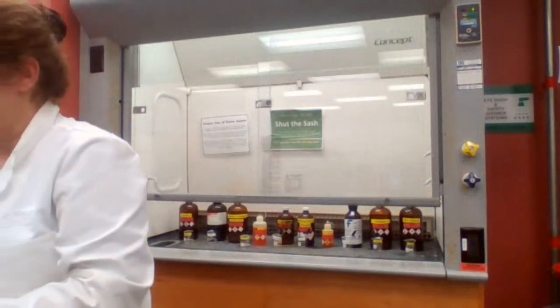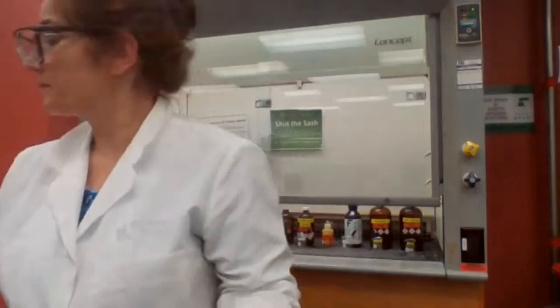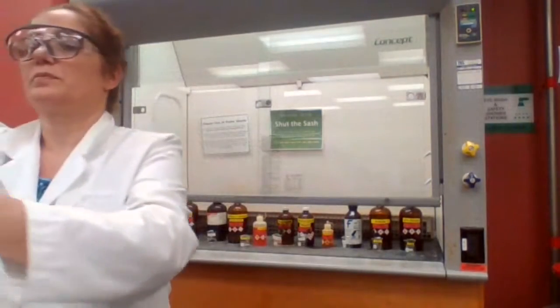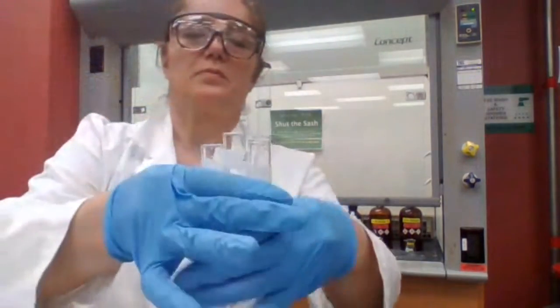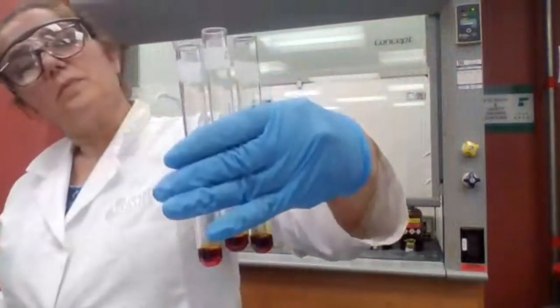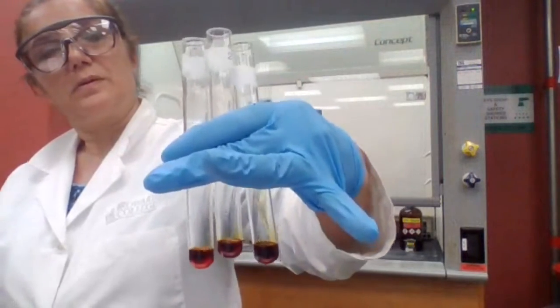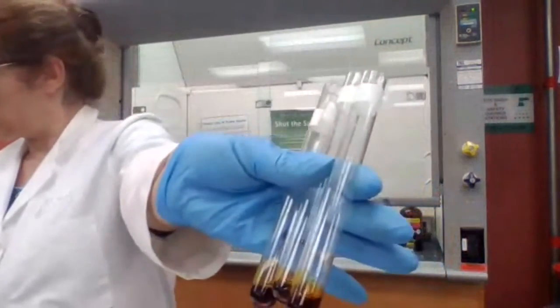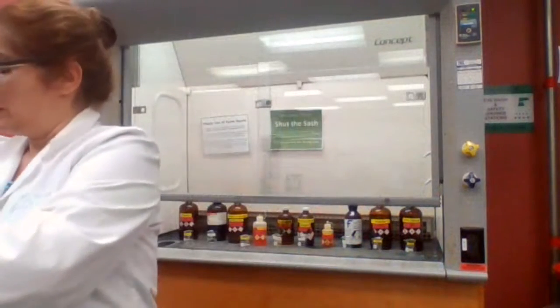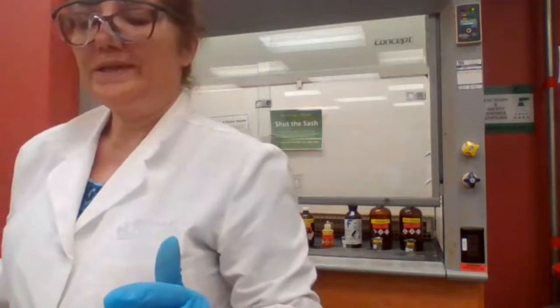Any questions? You see it? What is the next test for alcohols?